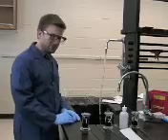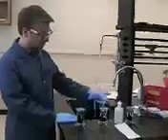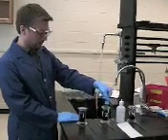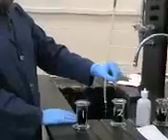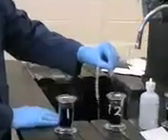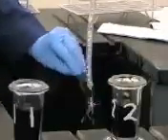So thanks to some wonderful videography, a minute has elapsed. And now we're going to remove our slide from the Gram's iodine. And again, let it drain off. Then hold it and rinse it off under the water. Give it a little shake. Don't dab it or wipe it.